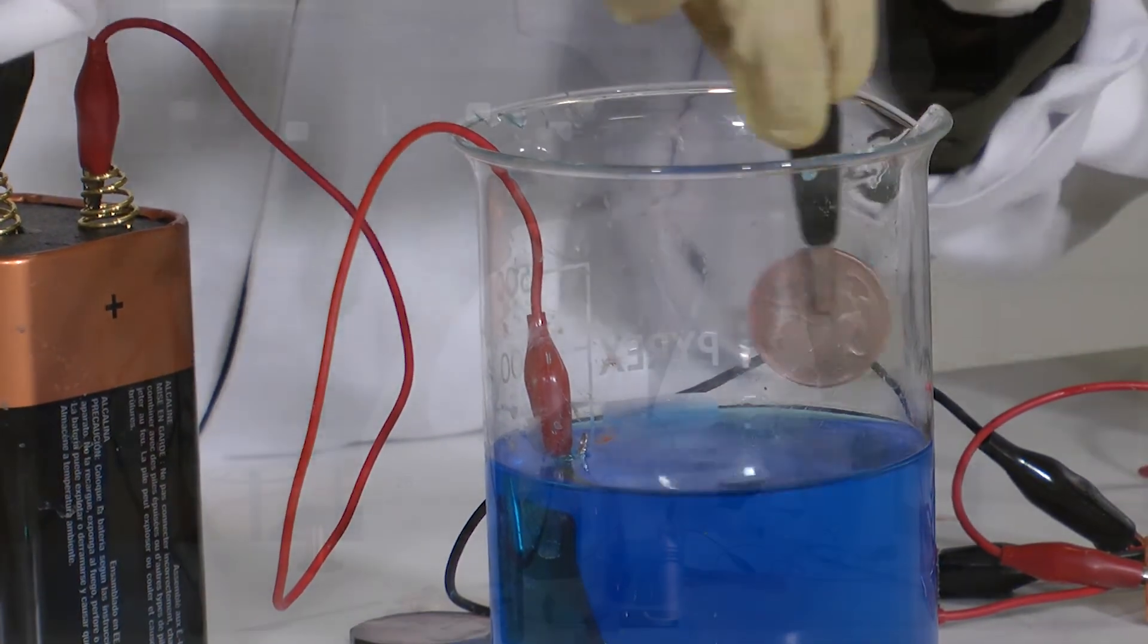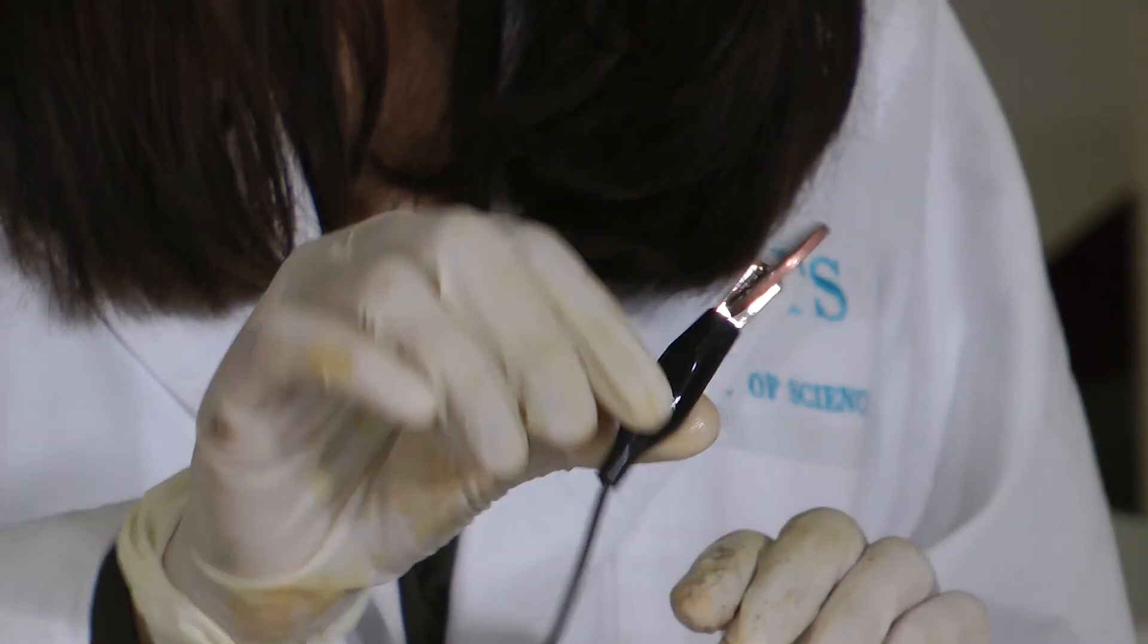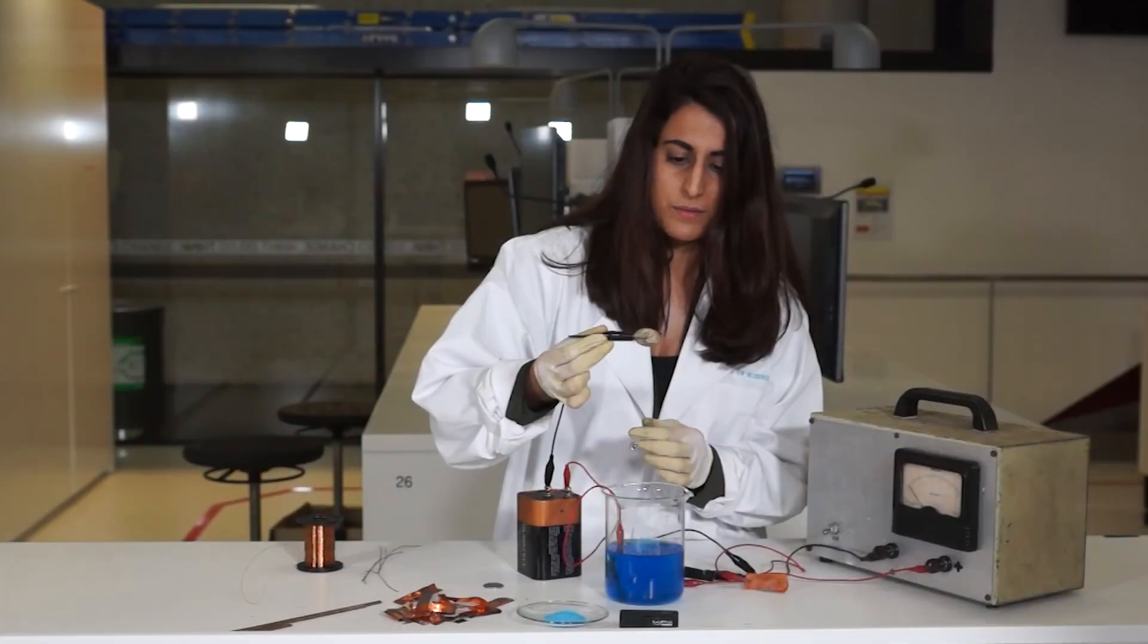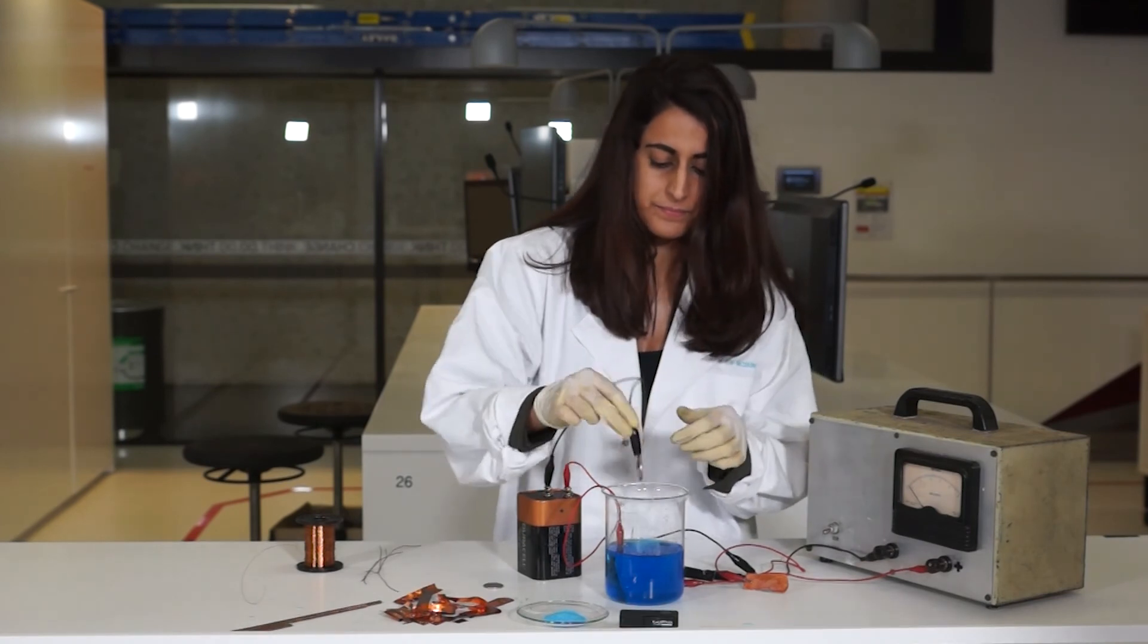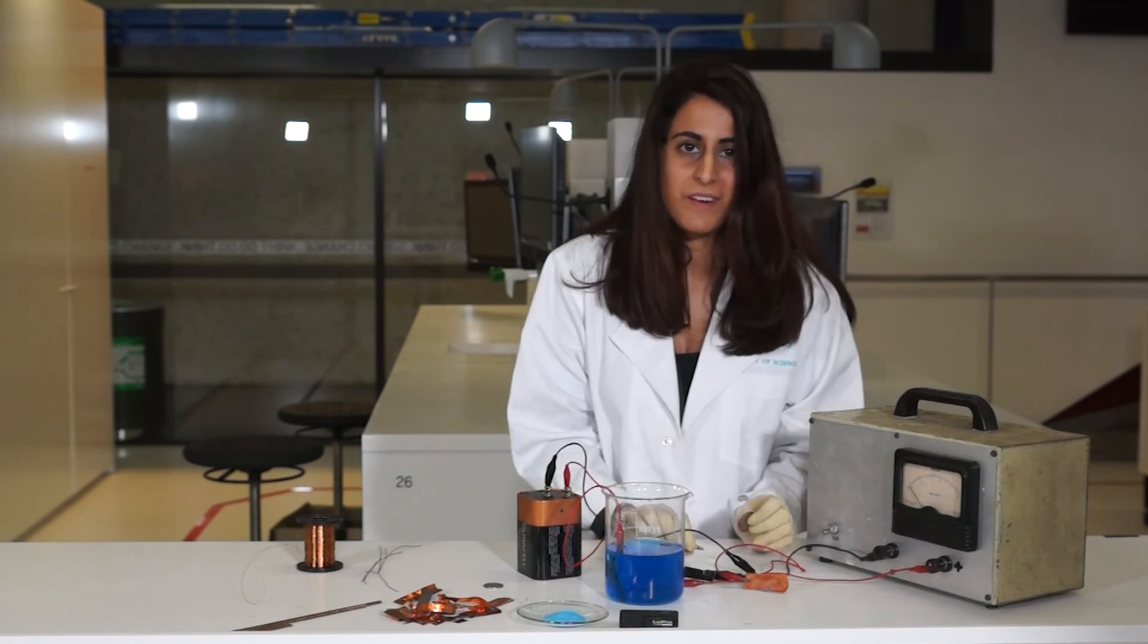Let's take it out. And you can already see that this is copper plating on this 20 cents coin. And now we have demonstrated copper plating.